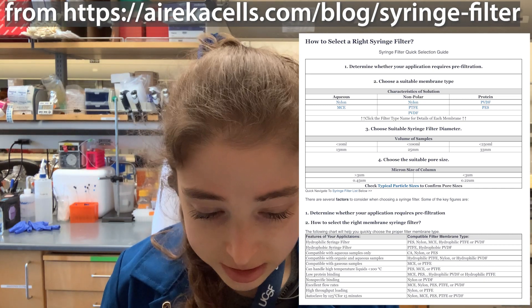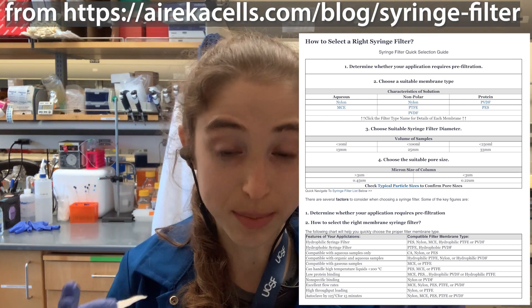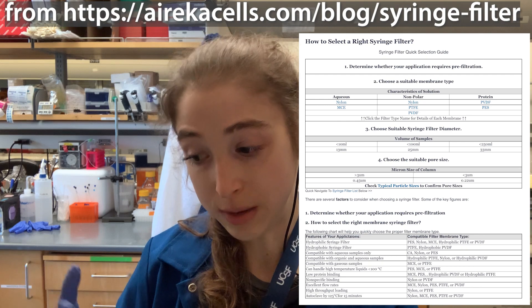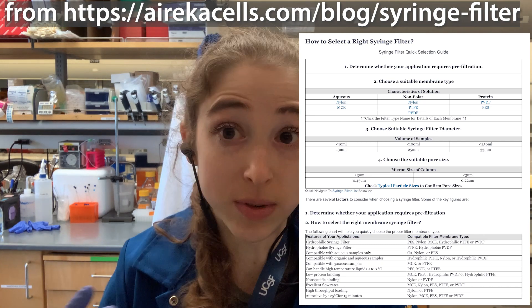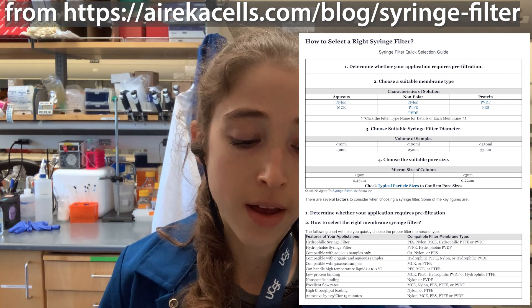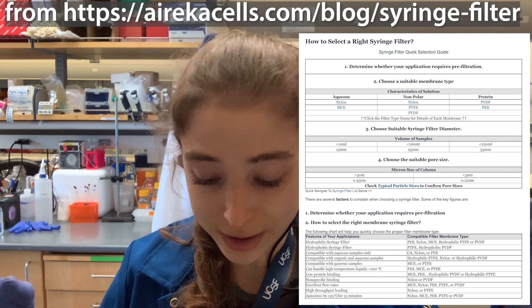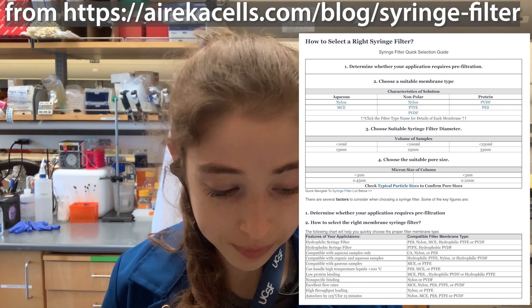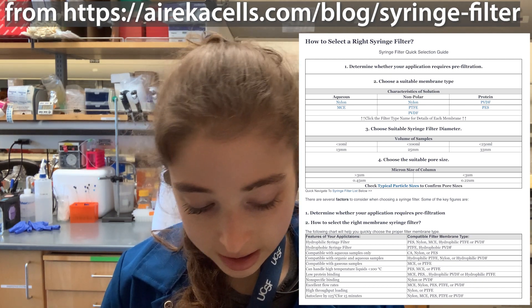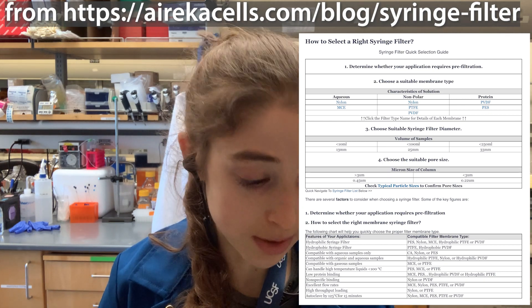Typically we use something like a treated PVDF, PES, or cellulose acetate — something that's not going to bind to your protein. There are various other specifications that might matter depending on what you're filtering. For all these filters you also need to choose the pore size of the membrane.